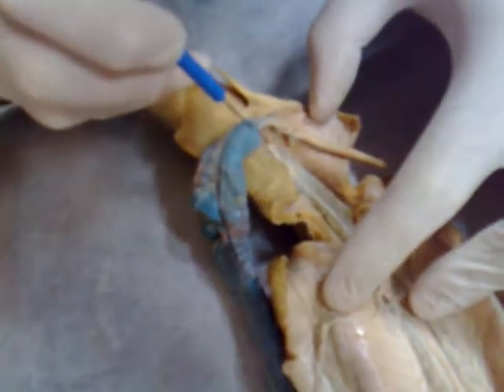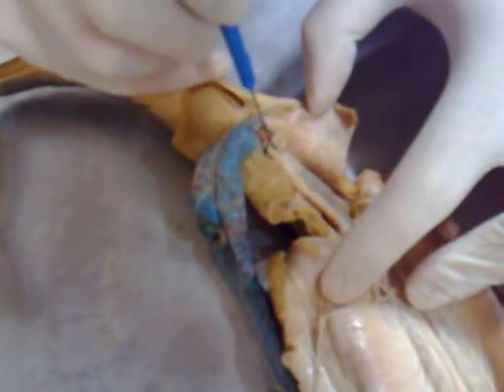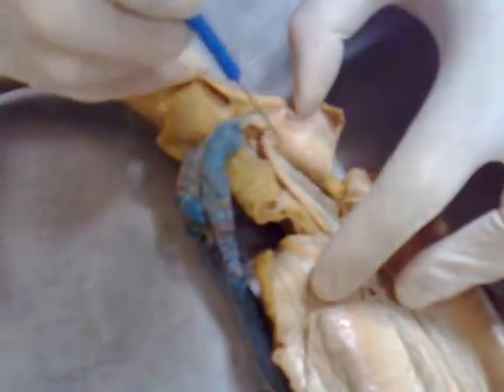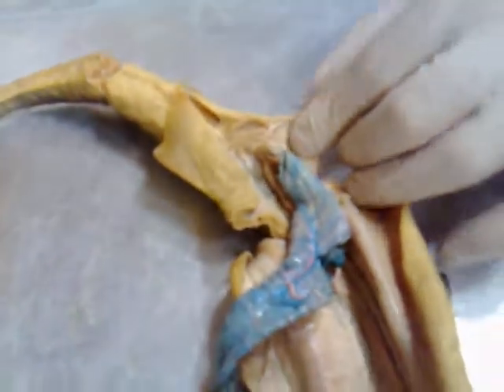If you follow this tube all the way down, it opens up here. This is the uterus. This one must be a juvenile because they're really small. See how it widens right at the bottom — this widening right here is the uterus.